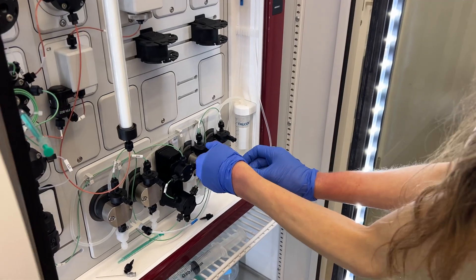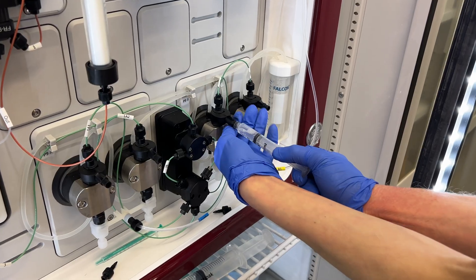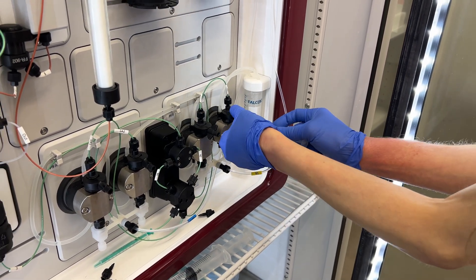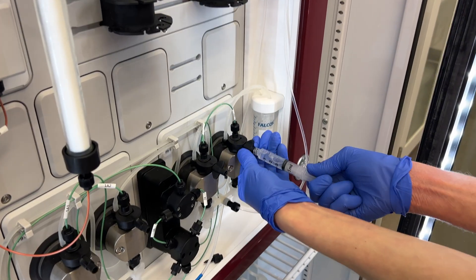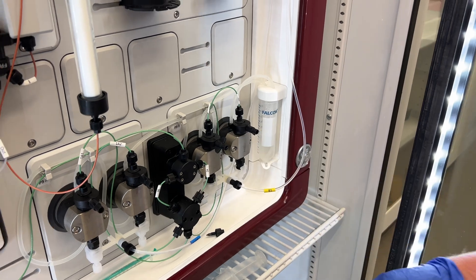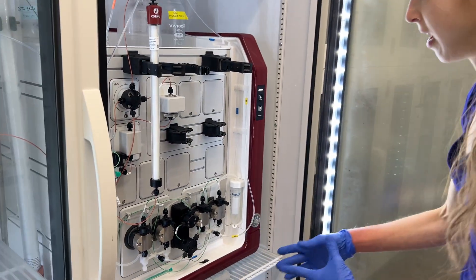With the syringe, you'd want to have a bigger syringe probably, but you just want to fill it a little. It's especially important to do this if you see that you have any air bubbles in your line, as that'll help get rid of the air from the system.